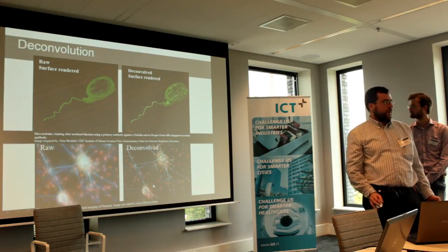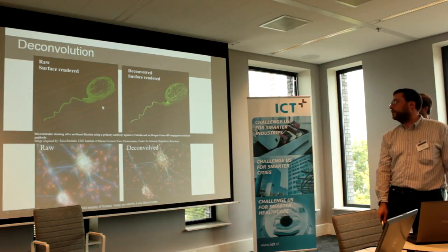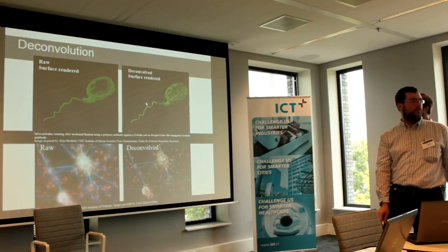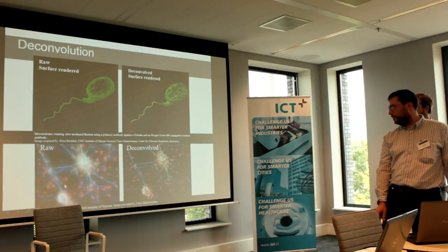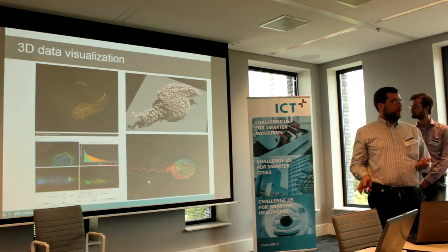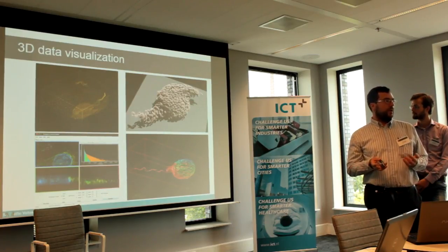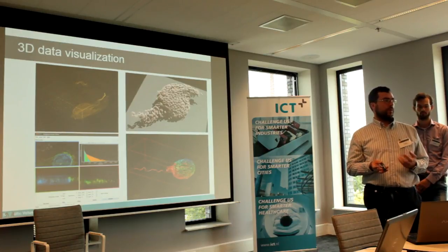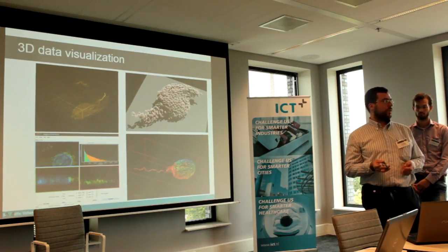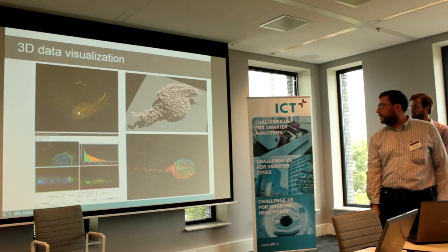So here you can see some examples of what the deconvolution does to an image. This is the same image that you saw in the movie, where you see a surface rendering of the raw data compared to a deconvolved one. And this is an image of neurons, where you see the raw data visualized and the deconvolved compared to it. The software has different ways to visualize data. Usually it is 3-dimensional or 4-dimensional, where there is a time dimension, and then there can be multiple channels, like multiple colors. If you do fluorescence microscopy, you can have multiple fluorescence channels, which are acquired simultaneously.